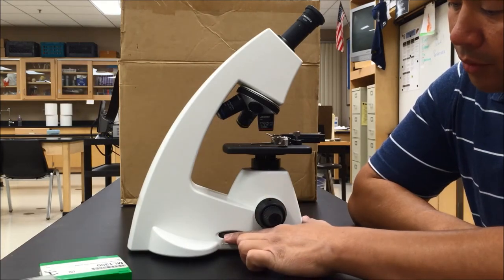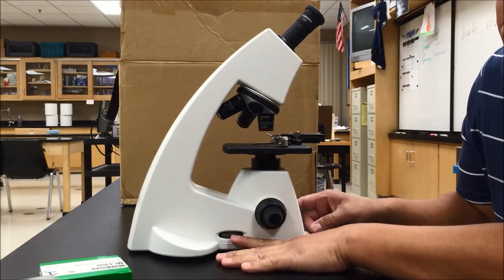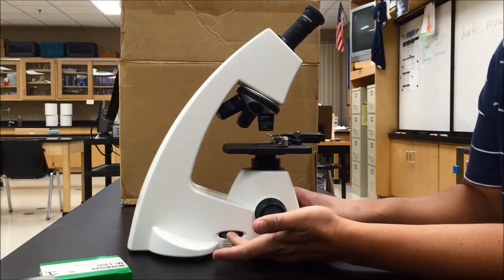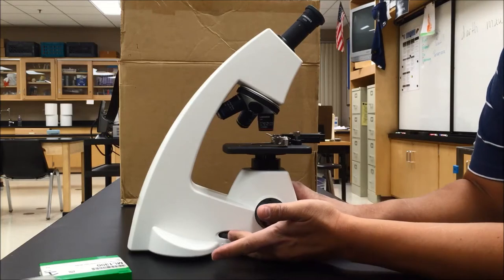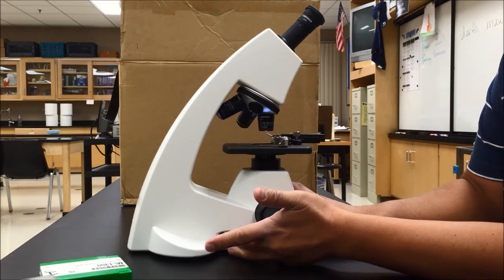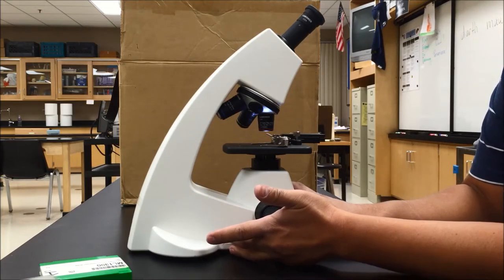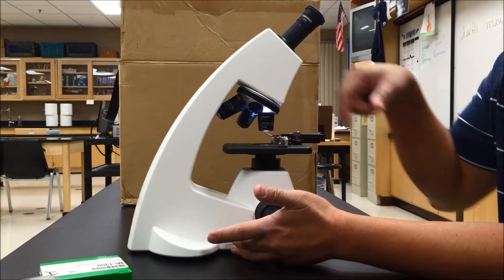The first thing you want to do is turn on the power. This dial right here is the power button, but it also serves as the diaphragm. When you turn the power on, you can control the intensity of light that appears through your field.